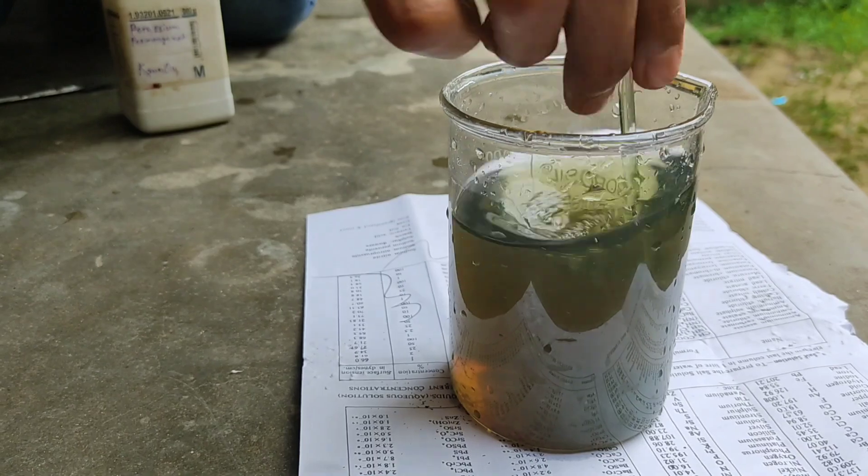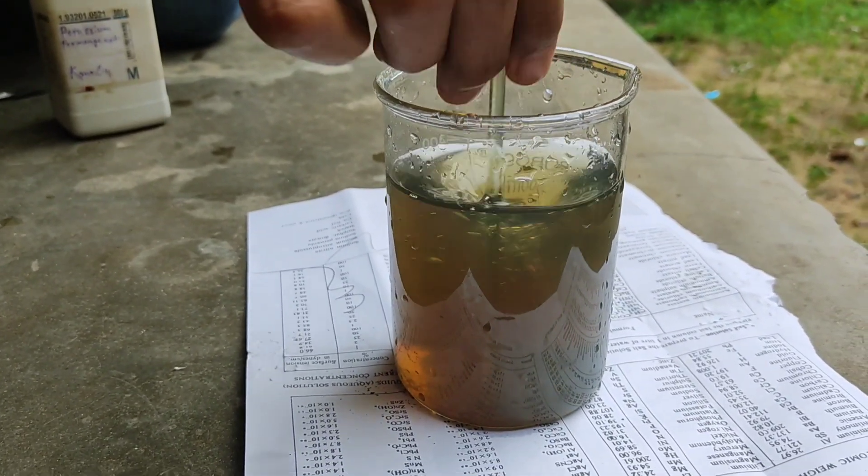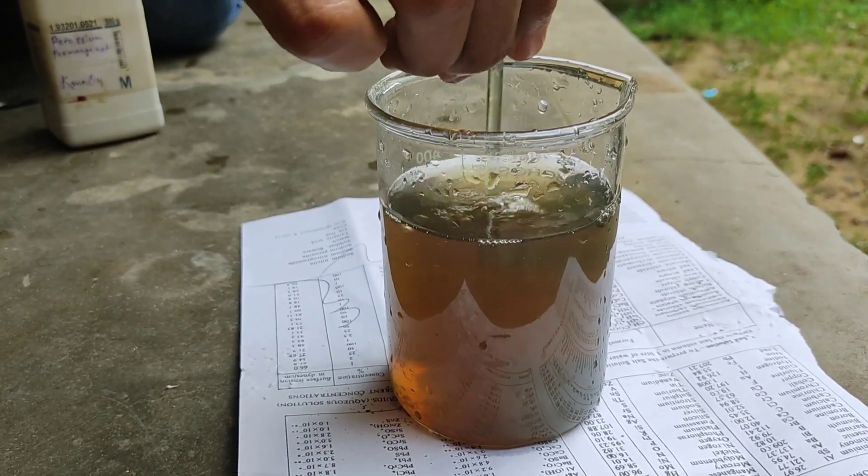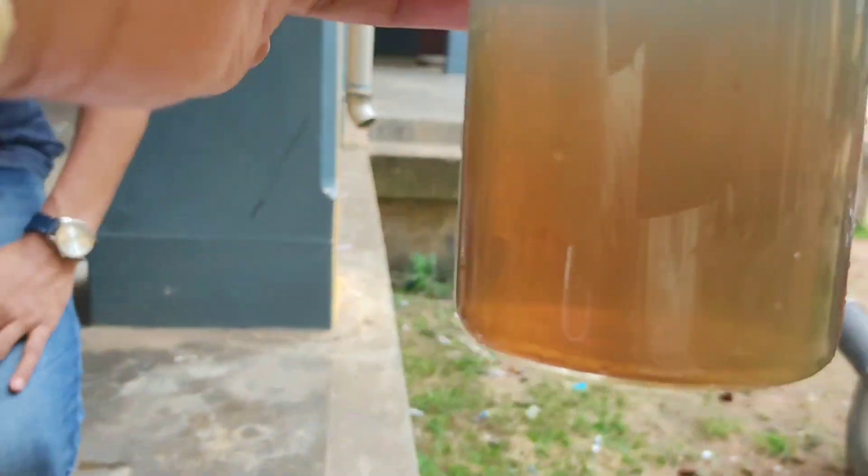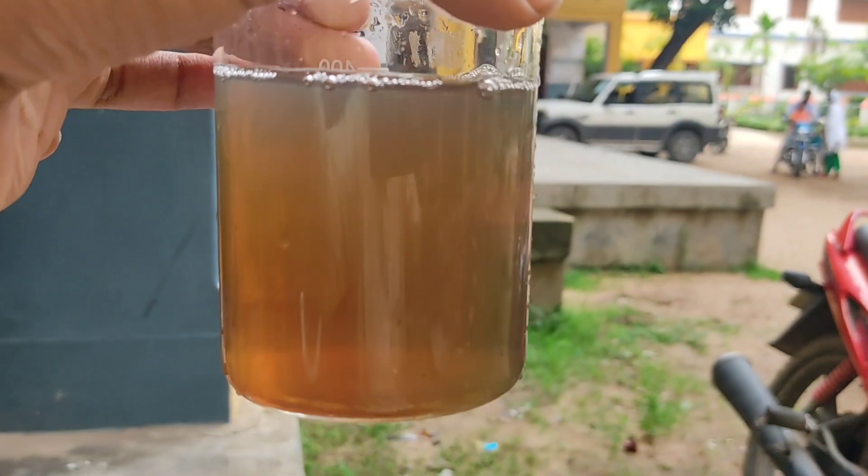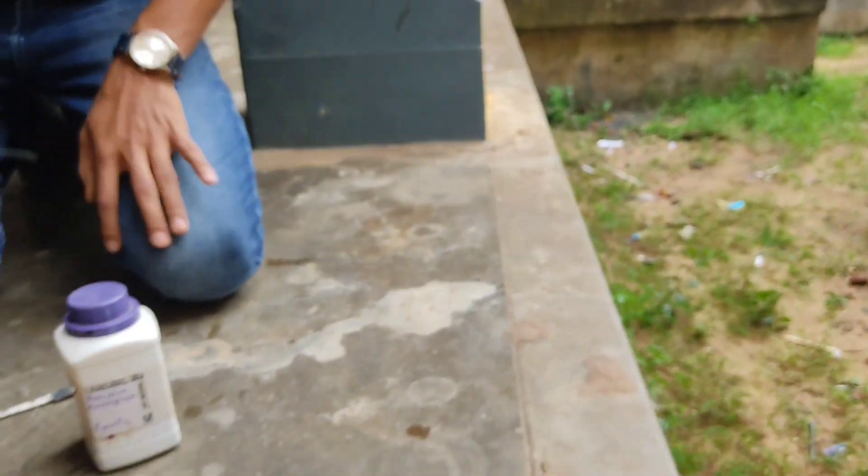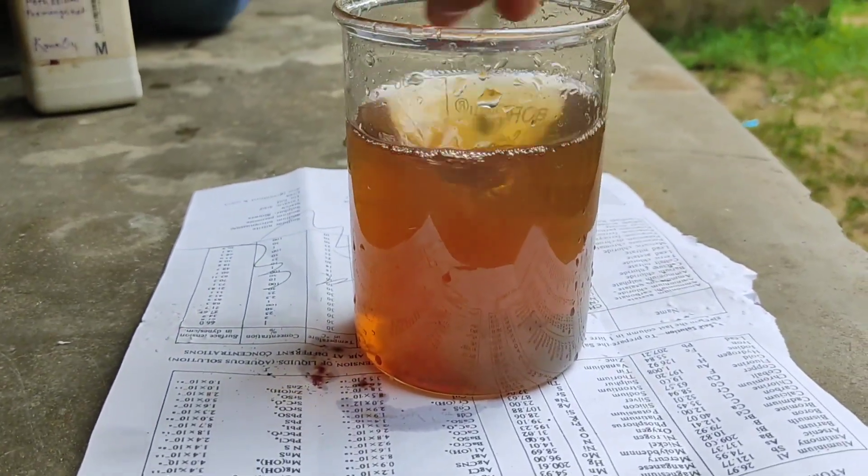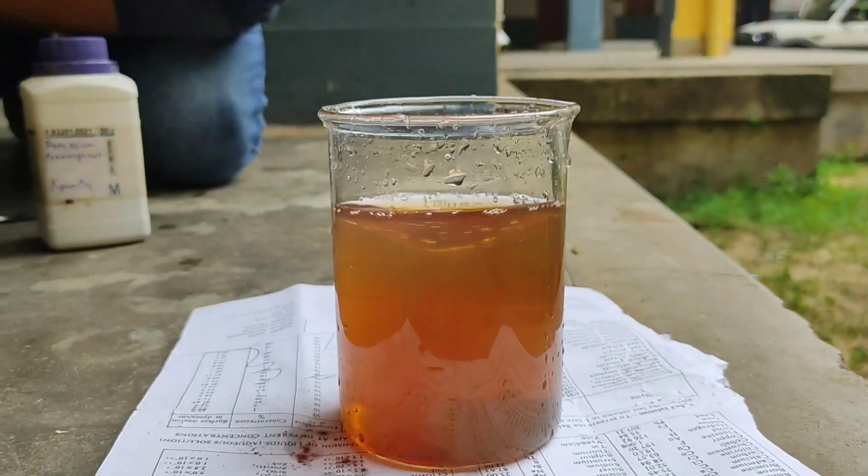Finally, we have MnO2, which appears yellow or orange. Since the color changes from purple-violet to blue, then to green, then to yellowish-orange, it is termed chameleon.